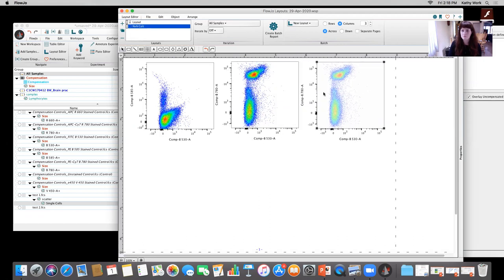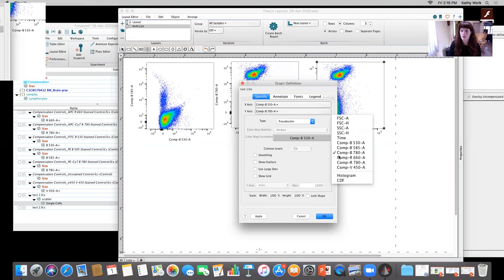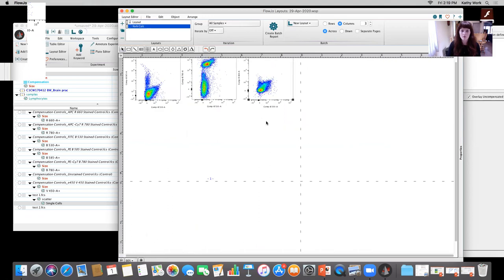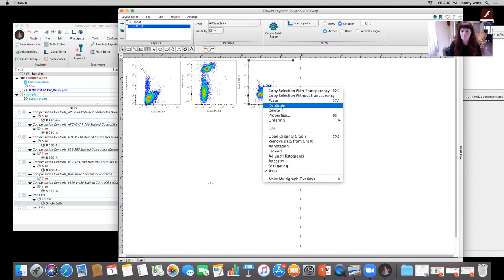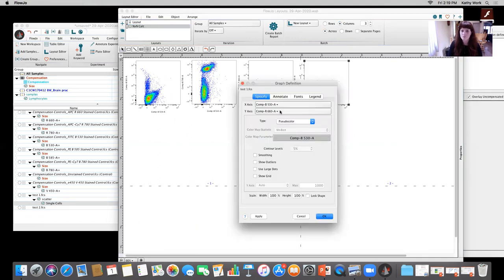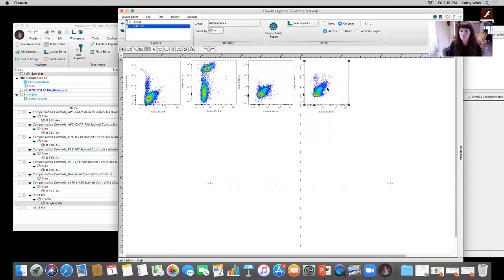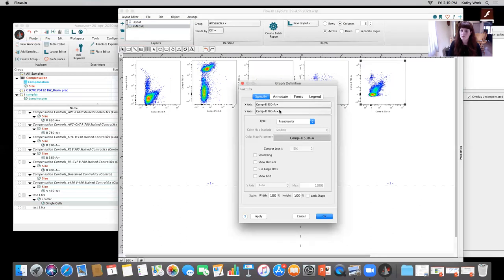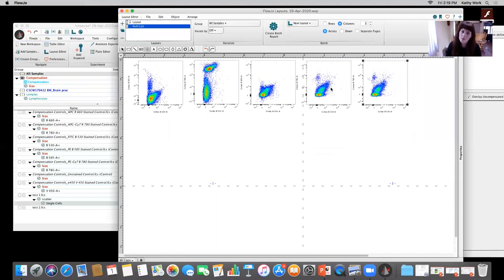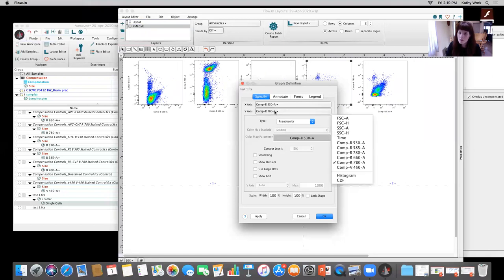Again. So this is just how I make my own little N by N plot because I find it a little bit easier to work with as opposed to working with the N by N where the data might be a little bit scrunched and hard to pull out in that compensation window. Okay. One more after this. So I'm going ahead and visualizing everything versus the first detector that I looked at. Okay. I think I might have duplicated that one. Just double check. V450, this one should have been.